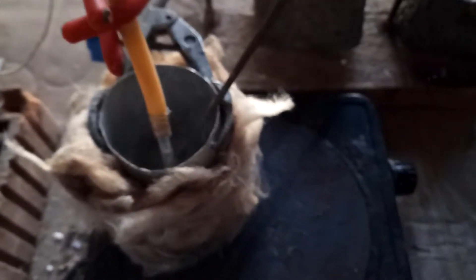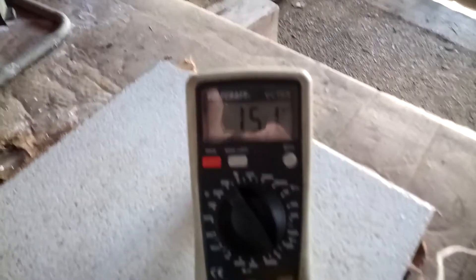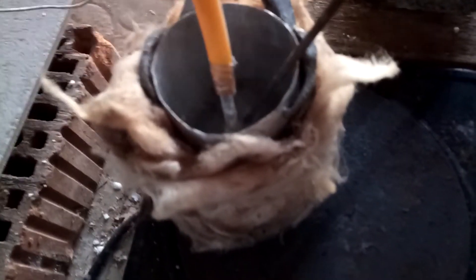After quite some time on the hot plate, it has finally all melted, because that usually takes pretty long with urea. You might be able to see in there it's already bubbling and decomposing. It's putting off quite a bit of ammonia fumes, so I'm not going to stay around for too long. The temperature is at 151 degrees Celsius right now, which is a bit high, but I'm going to keep it a bit lower over the next while.